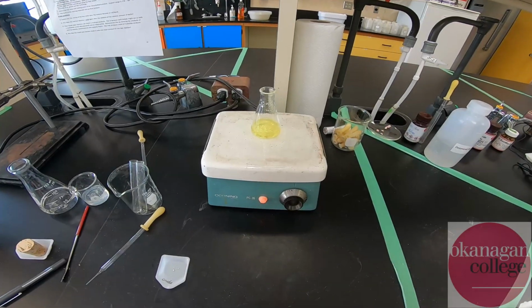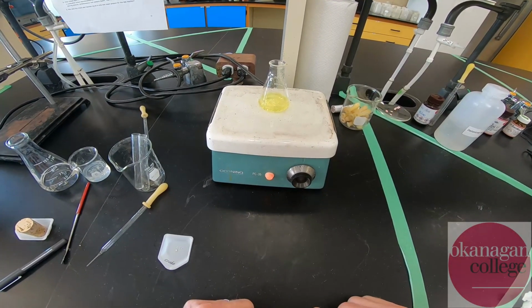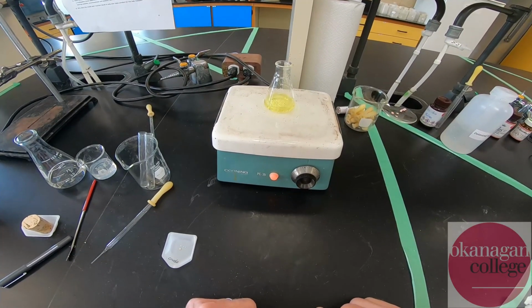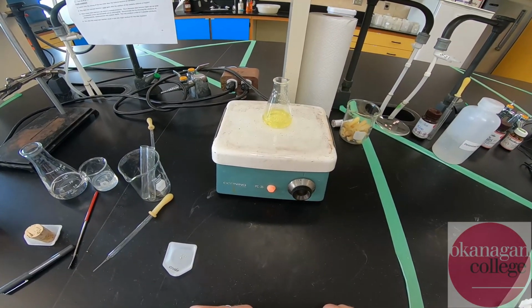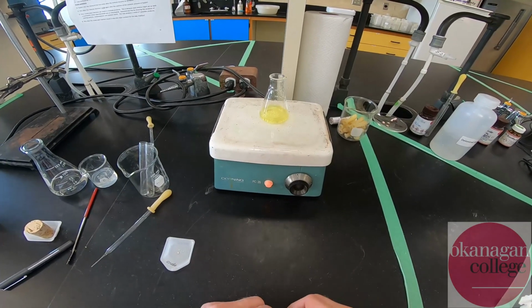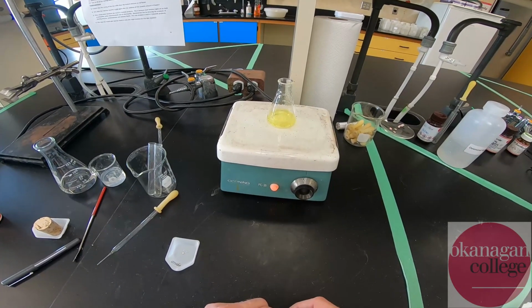Okay, in about another minute or two, if you look closely, you should be able to see the flakes starting to dance. That's an indication that the solvent is just about boiling. It's just boiling now, almost a simmer. At this point, we have to be kind of careful. If the evaporation occurs too quickly, we could end up frothing this material out of the flask, and that's no good because we'll lose a lot of our material.